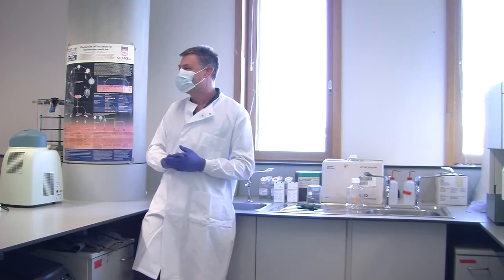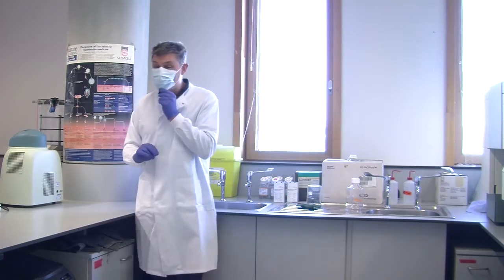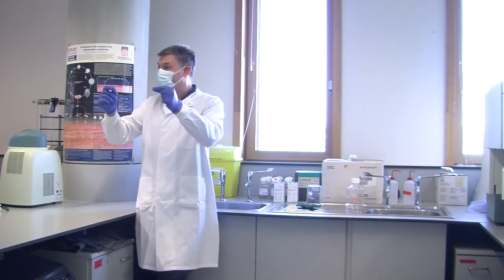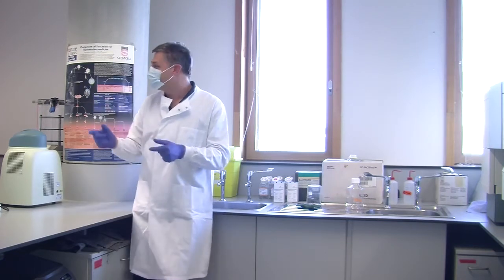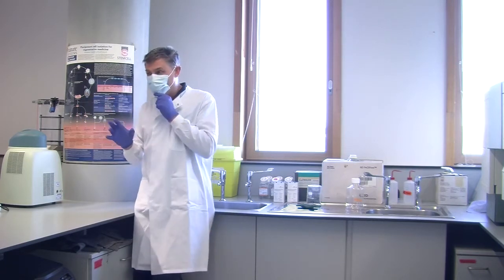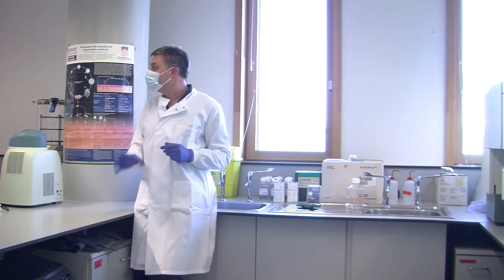Yeah. So did you do it right? I did, and you know what? Every single time I ran it, I'd hook the buckets on, I'd swing them out, and I'd check them, and I'd tap them, and I'd rotate it. I'd close the lid, and I'd go, right, and I'd open the lid, and I'd check the buckets. Which I was probably overcautious, but actually, in a way, making mistakes is good in research.